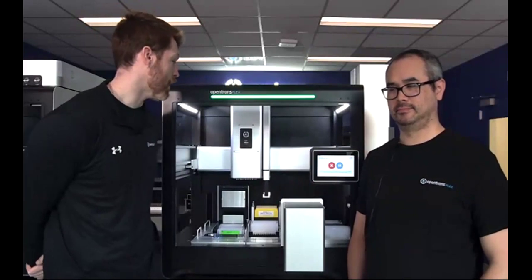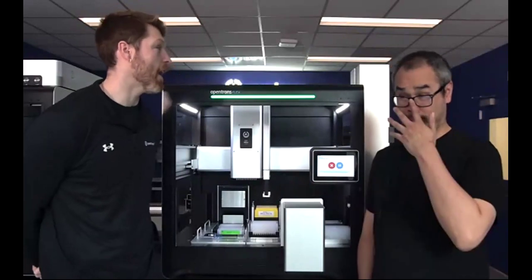But overall, as you can see, having 2 stackers means how many more tips and how much more capacity you can run in a full walkaway fashion. And you still have the ability to add 2 more stackers to this overall. So I think we can probably kick it over to Q&A.